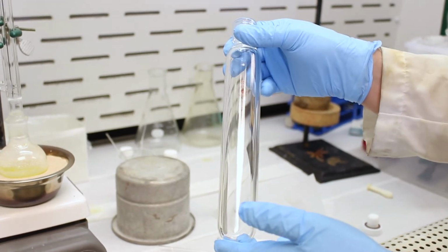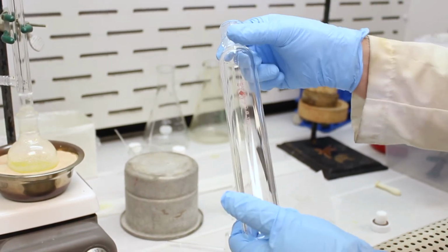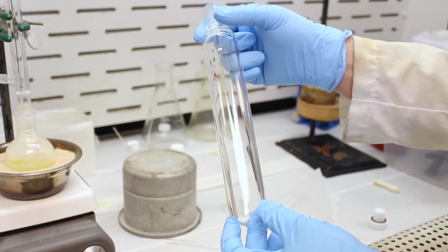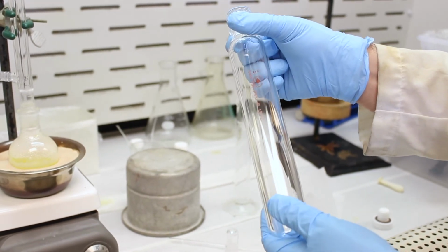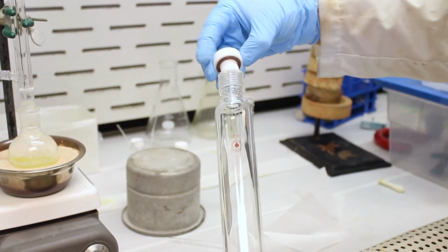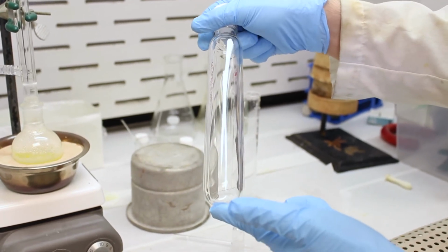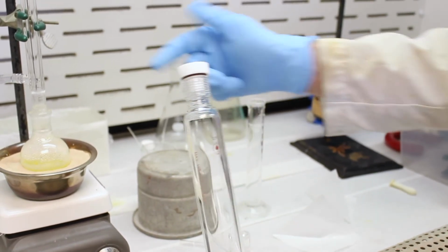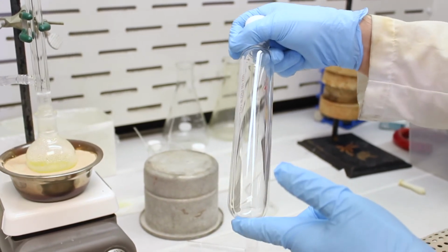The specific rule of thumb is that for every 10 degrees you increase the temperature, you double the reaction rate. There might be some variance in that, but suffice it to say, if we can heat it above the boiling point of whatever solvent we're using, then we can conduct reactions at a much higher rate. So water, which normally boils at 100 C, if you seal it and put it under an increased pressure, which is what this apparatus does, you take a special cap and then you seal this, this will increase the boiling point of water to not 100 C, but perhaps 120 to 150 C. And we've actually done this same Diels-Alder reaction in a sealed tube like this, and instead of it taking 1 hour, it takes maybe 10 or 15 minutes.